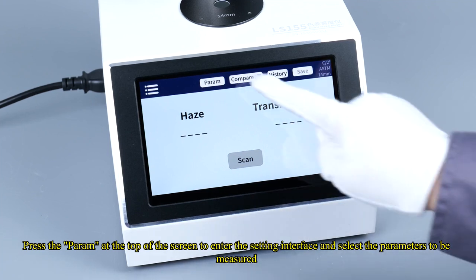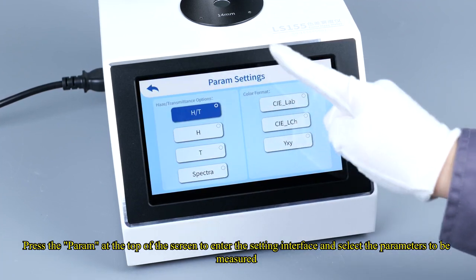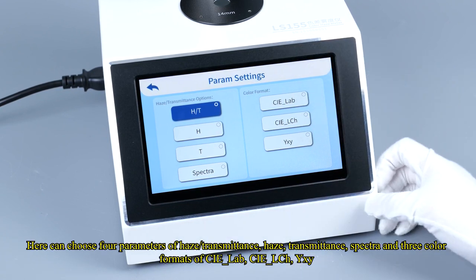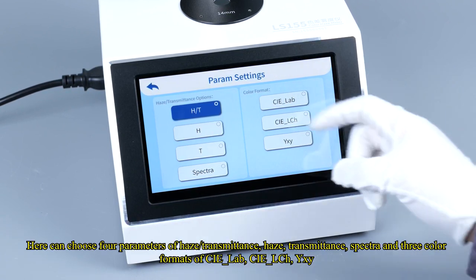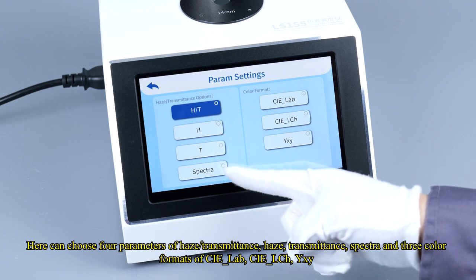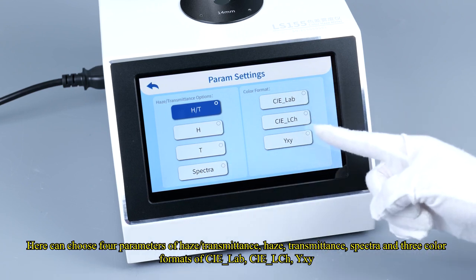Press the Param at the top of the screen to enter the setting interface and select the parameters to be measured. Here you can choose 4 parameters: haze/transmittance, haze, transmittance, spectra, and 3 color formats: CIE_Lab, CIE_LCH, YXY.